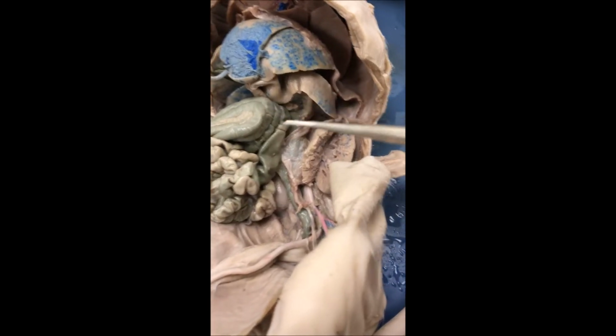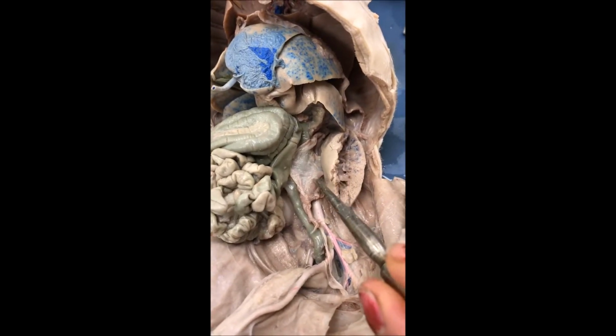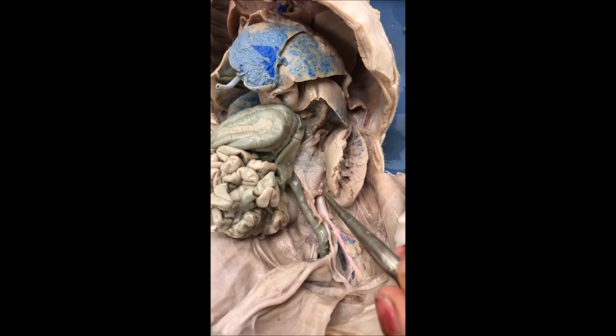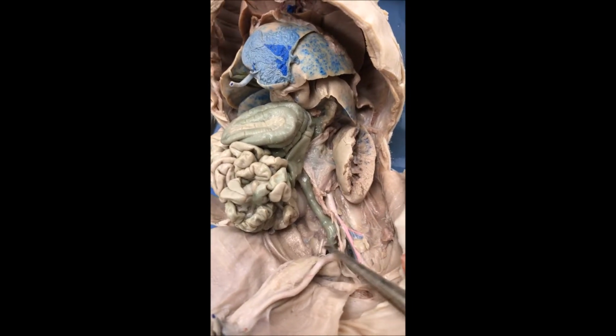Continuing on the lower part of the body, right here you have your kidney that's opened up to show the pyramids, which contain the glomerulus to filter the blood. And then the cleaned blood goes back through the renal artery and veins. And then the urine waste goes down through the ureter, down to the bladder, which is actually part of the umbilical cord in this fetal pig.